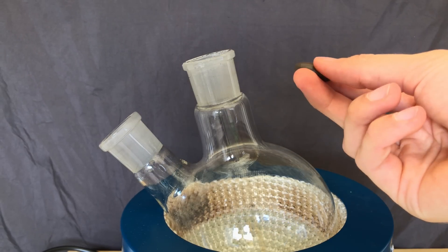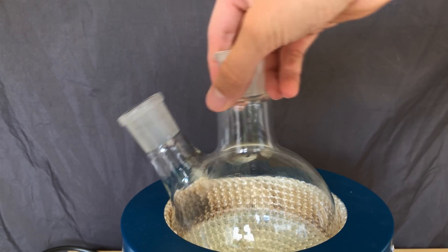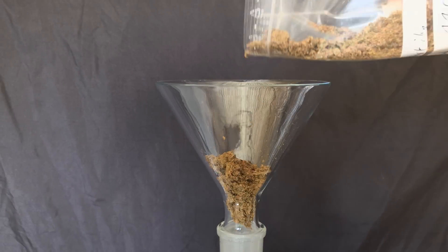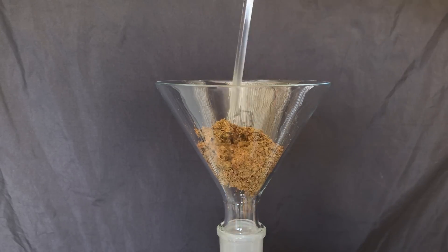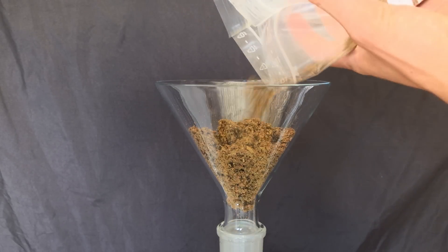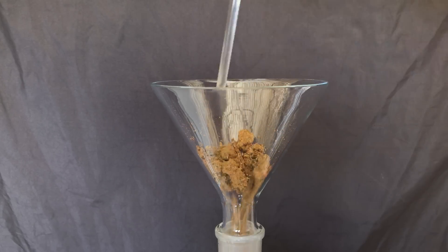The most important part which we shouldn't forget is the stir fish. Commercial tobacco contains up to 4% of nicotine in the leaves. Nicotiana rustica, however, contains up to 8%. The dried leaf material even contains up to 16% of nicotine.